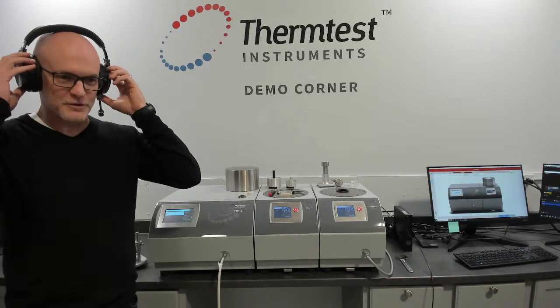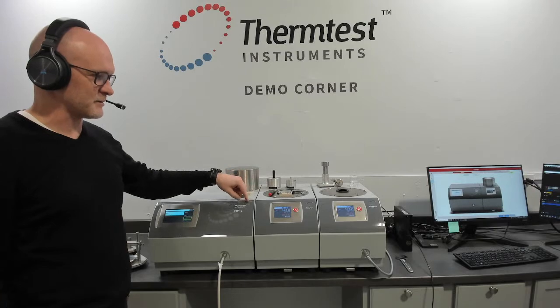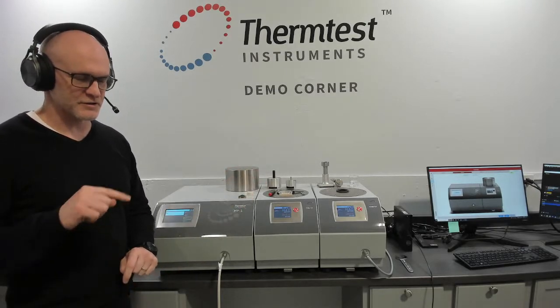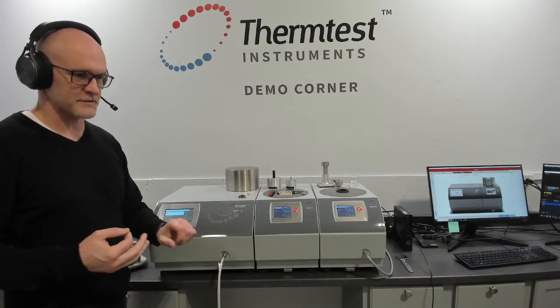Welcome to the demonstration corner. Today we're going to talk about the temperature platforms that are available on the MP-1. But before we do that, we're going to just turn the camera around and show the methods that are available for demonstration and one-on-one training and after-sales support.